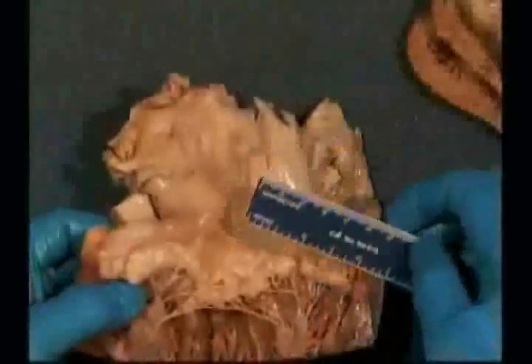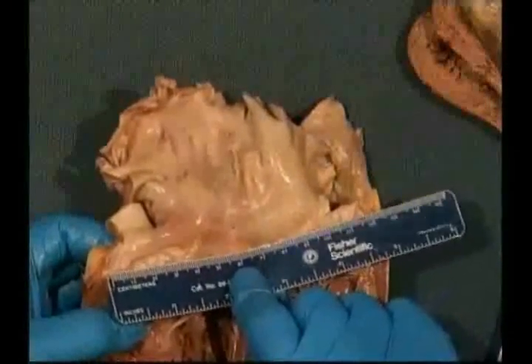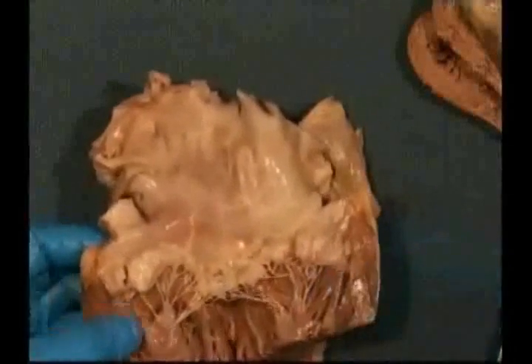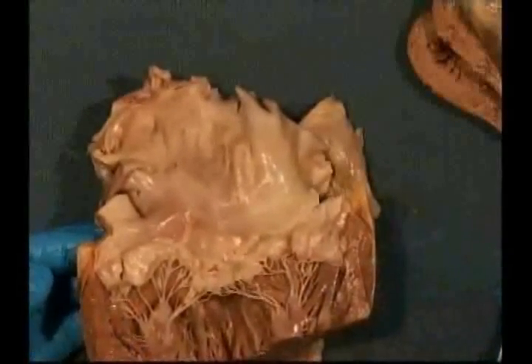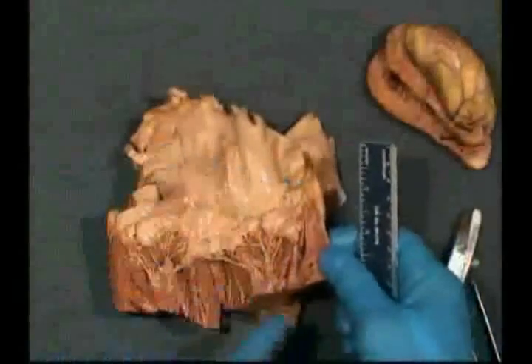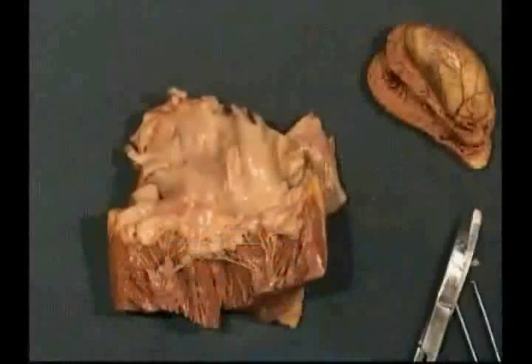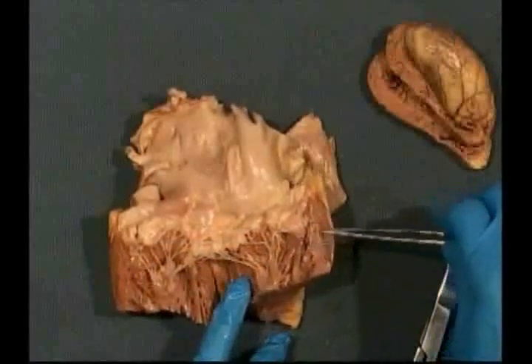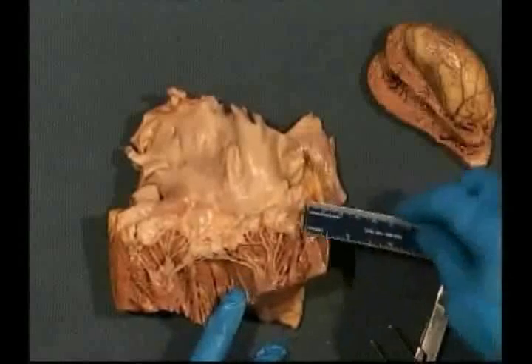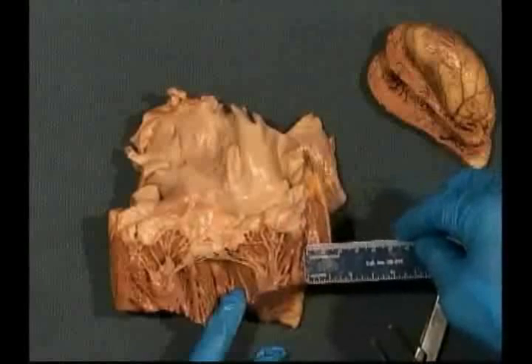We can measure the mitral valve the same way, which in this case is about 12 centimeters. Next we measure the left ventricular wall thickness. So where do we measure that? Again, we want to measure away from the papillary muscles where there are not a lot of trabeculations. A good place to measure is the posterior wall of the left ventricle behind the mitral valve. In the normal heart, the LV wall should be 1.5 centimeters or less.